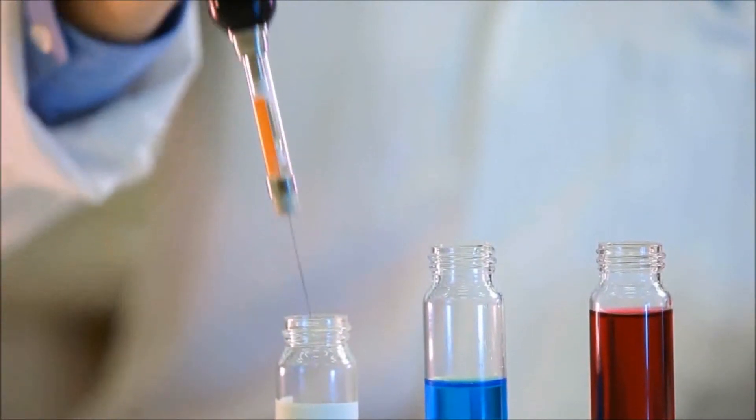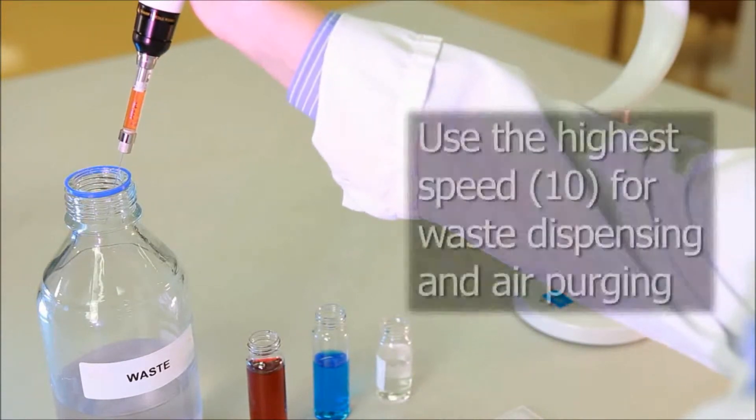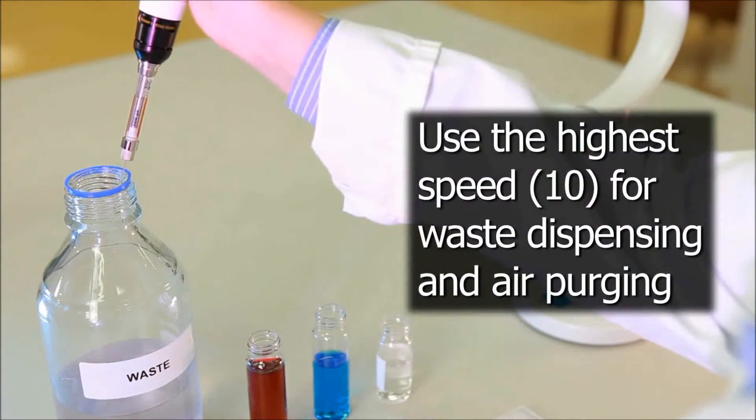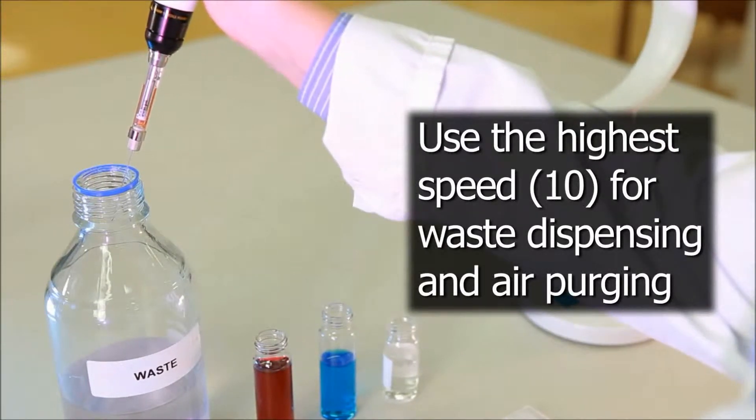Now it's time to change solutions. To clean the syringe between solutions, Catherine washes the syringe once with 500 microliters of water and then once with an air purge. The syringe is then ready for transferring the new liquid.